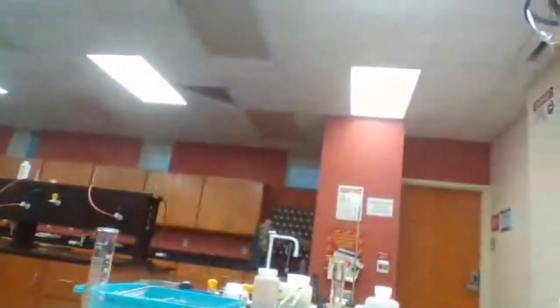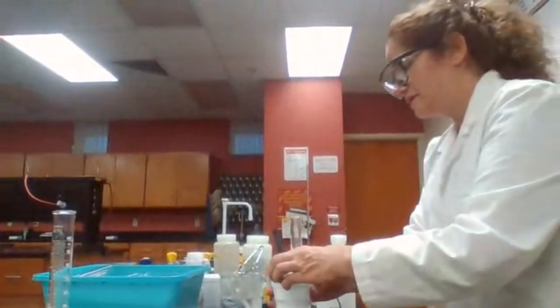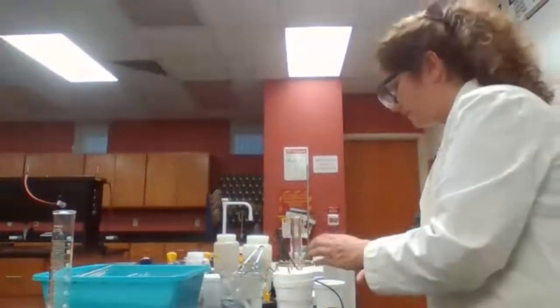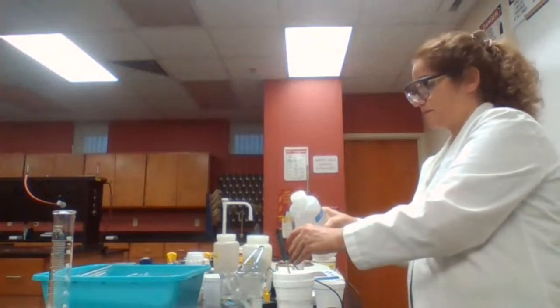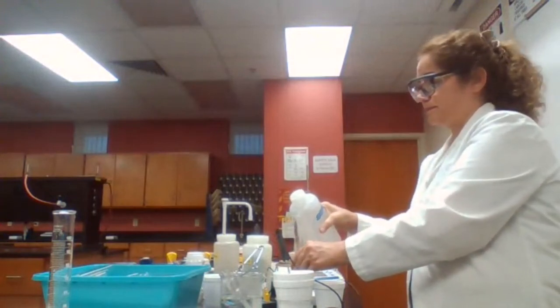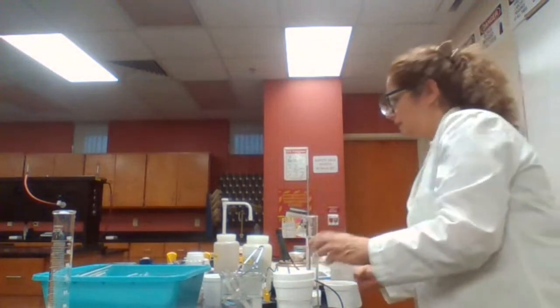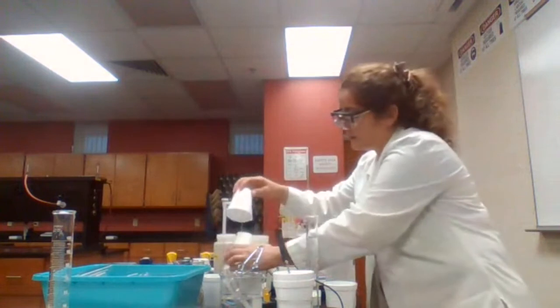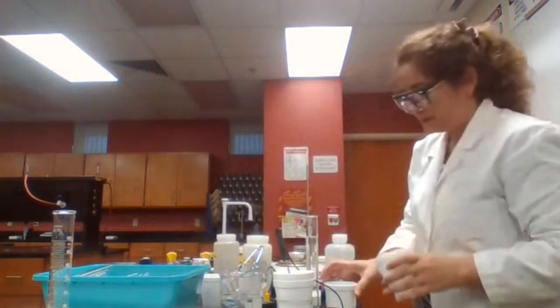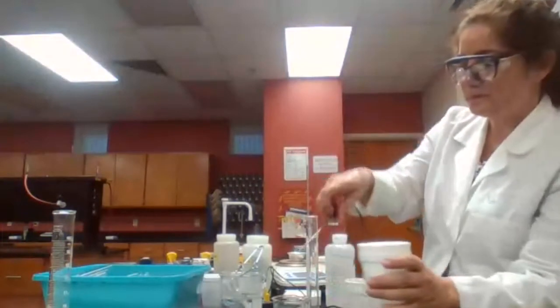And we are going to get 100 milliliters of water. Use the beaker again.